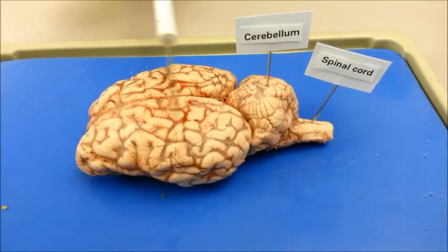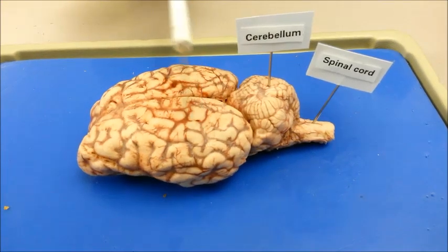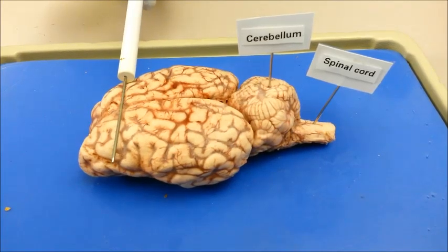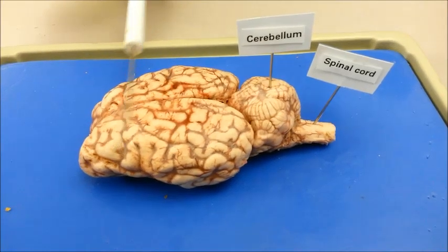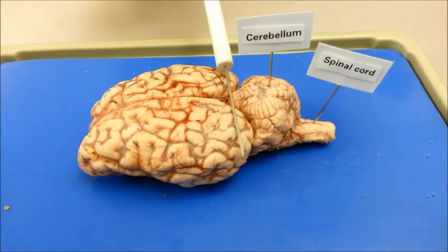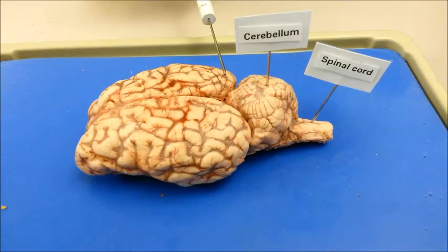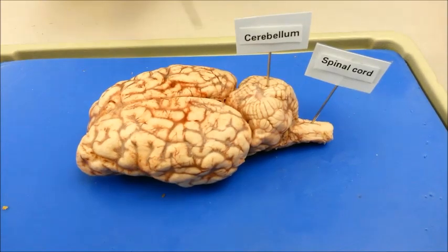The parietal lobe, located in the mid-region of the cerebral cortex, is associated with pain receptors, depth perception, and cognition, which is the process of thinking and understanding. The occipital lobe, located in the back region of the cerebral cortex, aids with vision and color recognition.